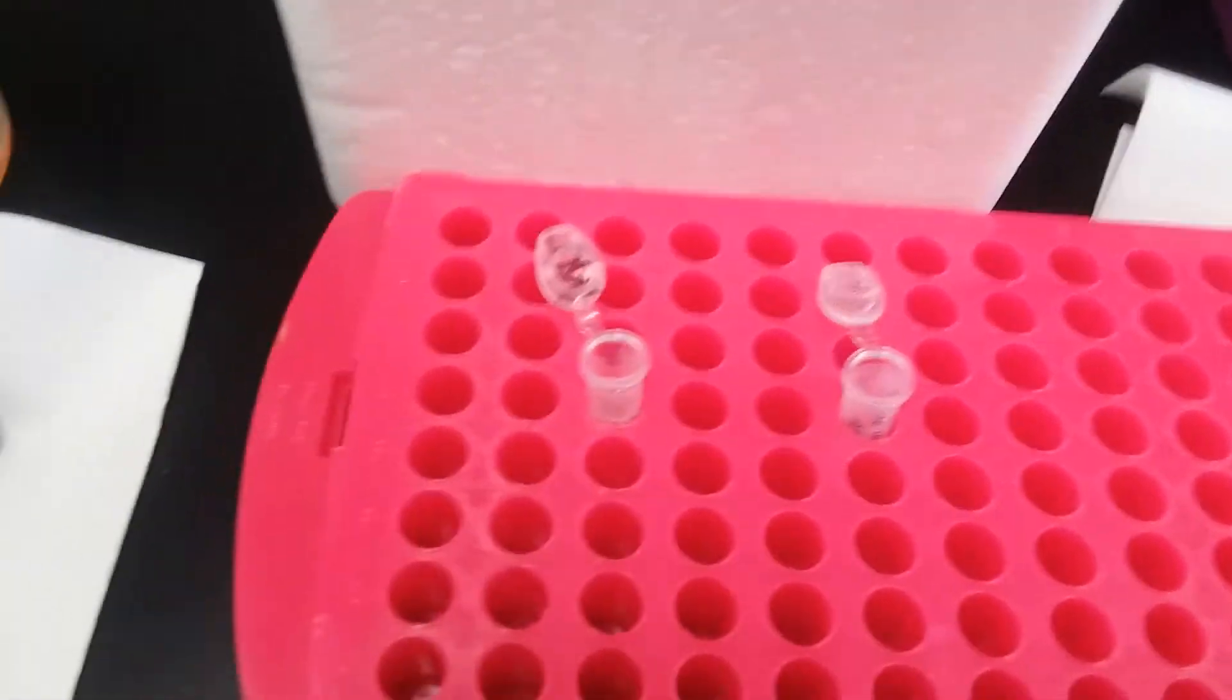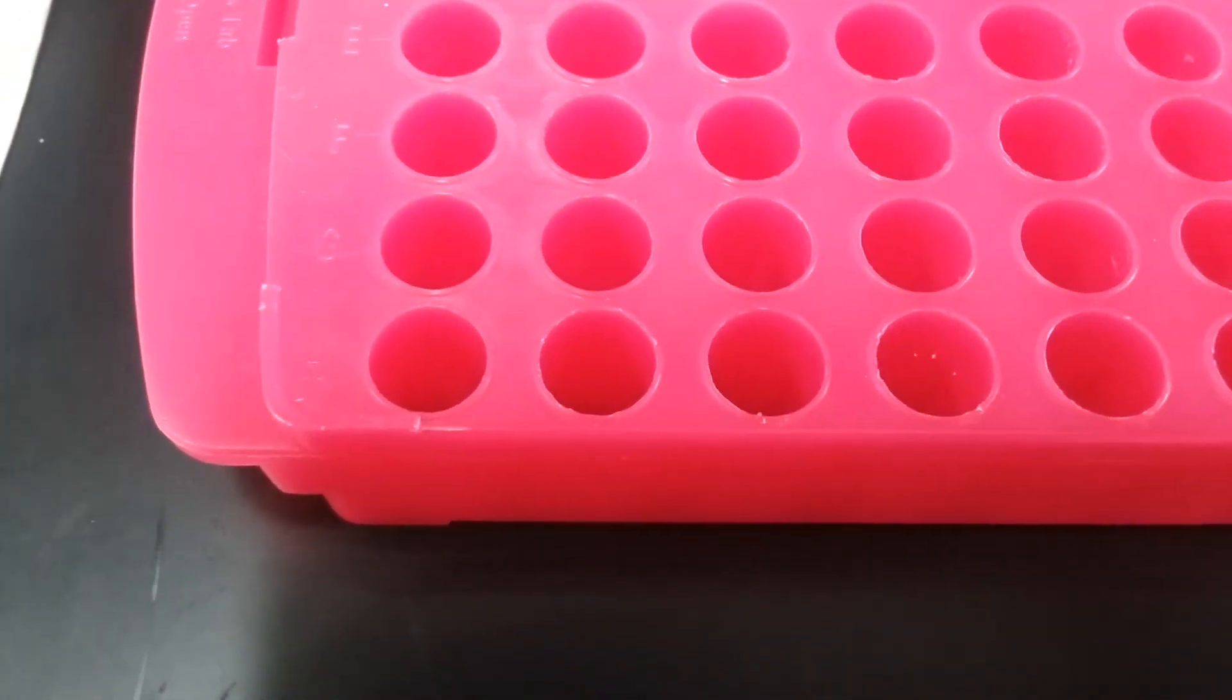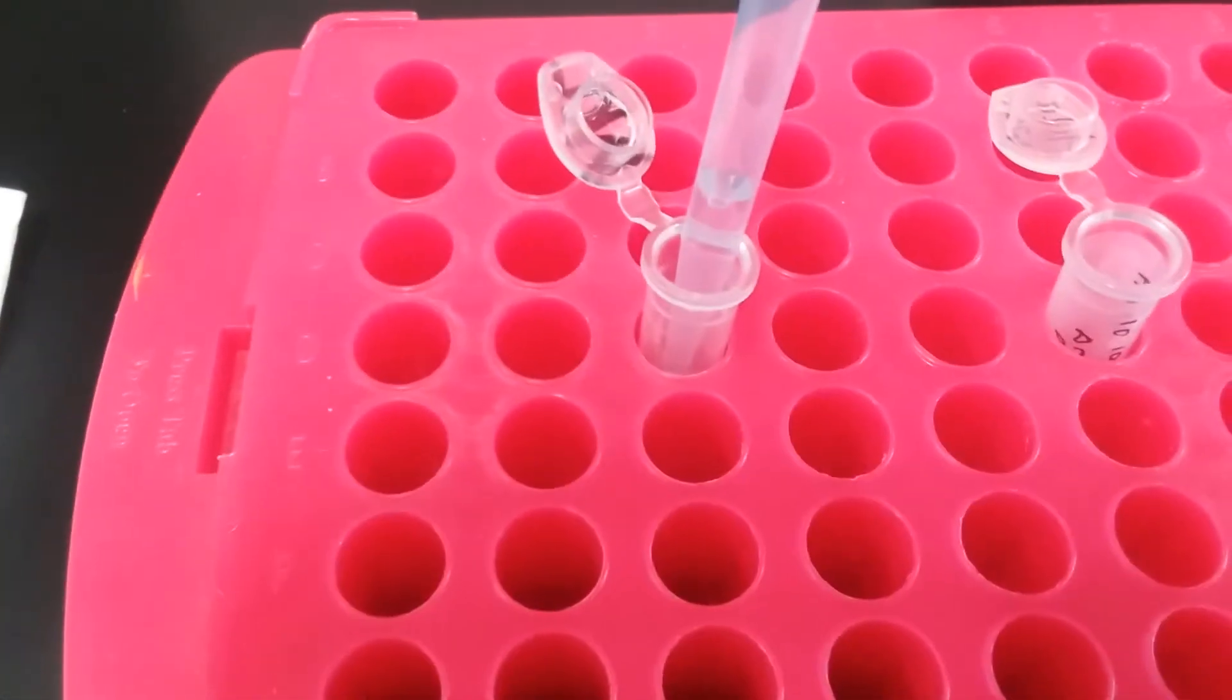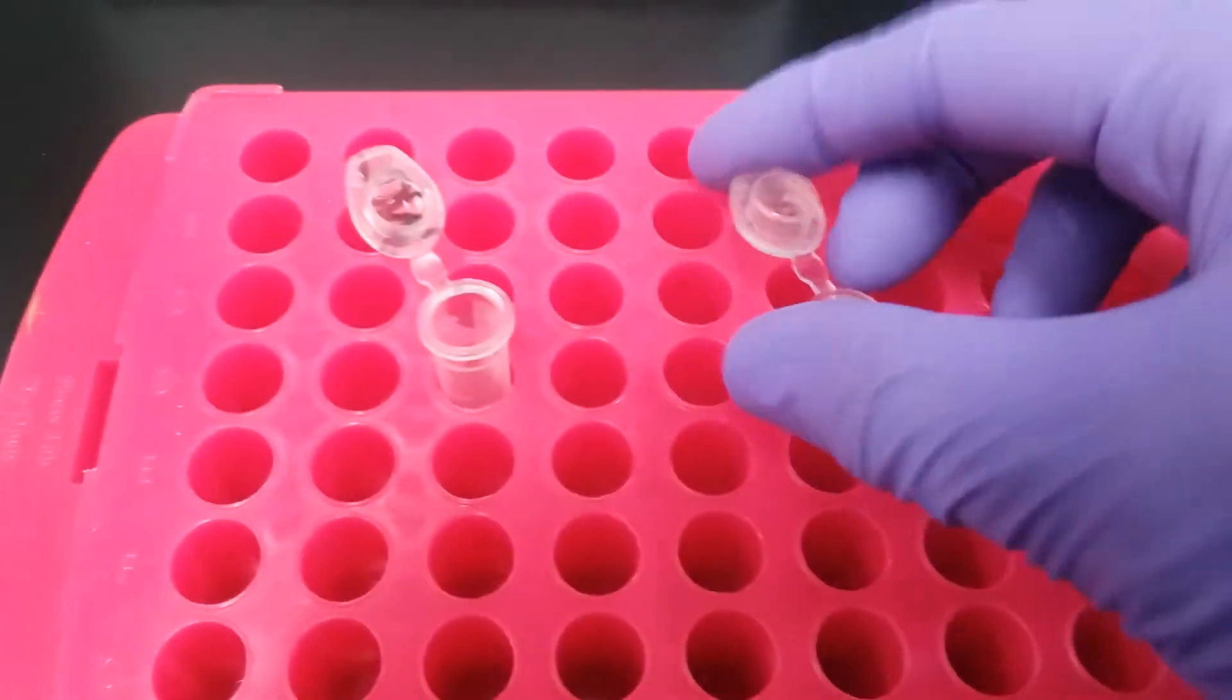I'm going to avoid any kind of pellet, which I know is on the other side. And I'm going to just get my whole cell lysate out of this tube, taking it to the bottom, and move it to this tube. And here I have my whole cell lysate. I will put it into my ice until a time when I can find myself a beautiful little storage box.